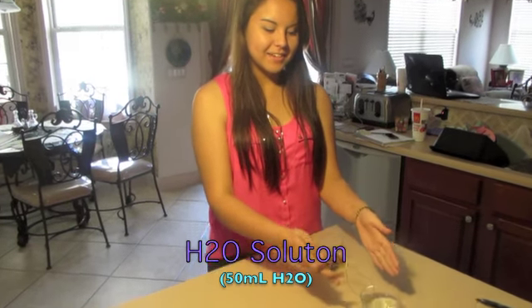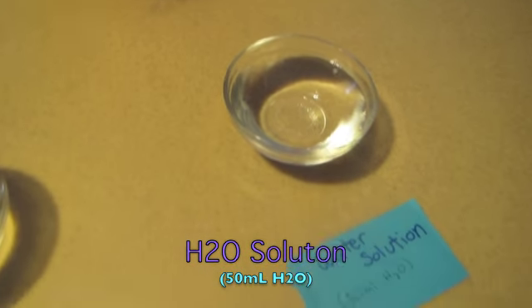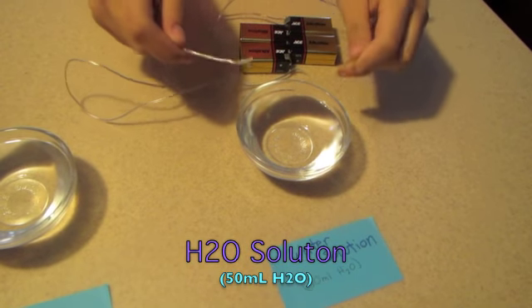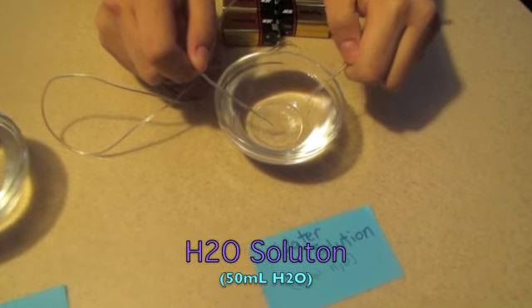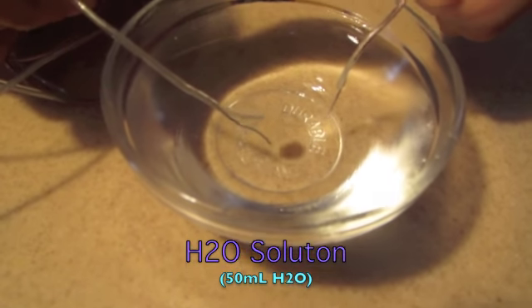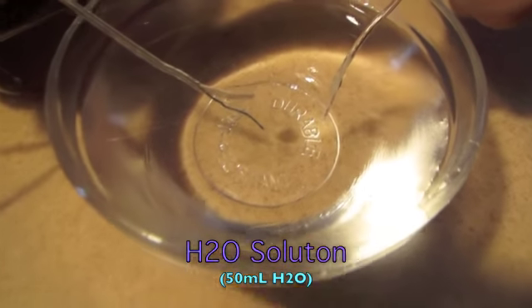In this container, we have 50 milliliters of regular distilled water, and I'm going to add electricity into the water to show this covalent bond. As you can see, little bubbles are forming.